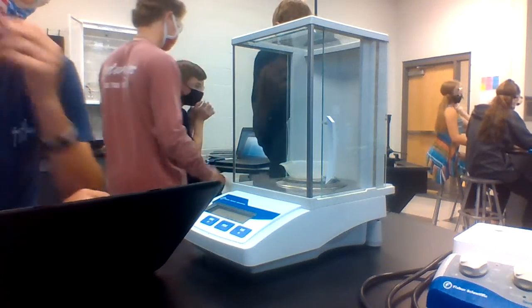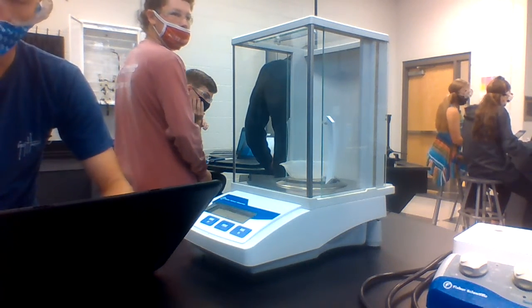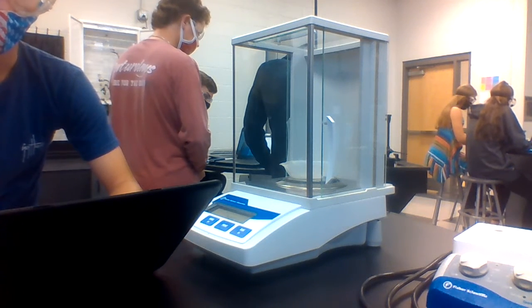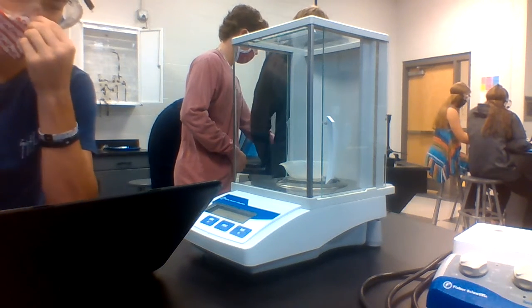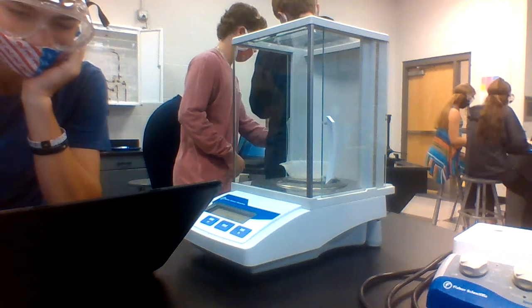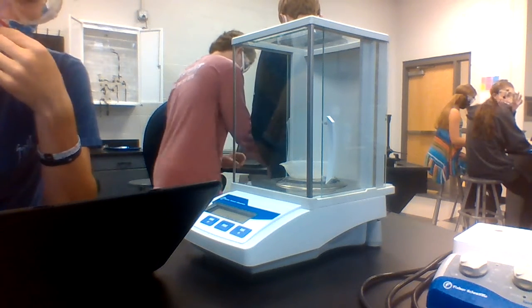Now, is your volume going to be 1 milliliter? Is it going to be 1.00 milliliters? Is it going to be 1.000 milliliters? How accurately did you measure in that beaker? Mine says 1.2951. Okay, you will write down all your decimal places. On the masses, on the balances, write down all the decimal places that are given on that balance, because those balances are accurate to those decimal places.